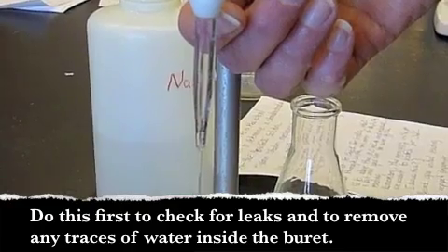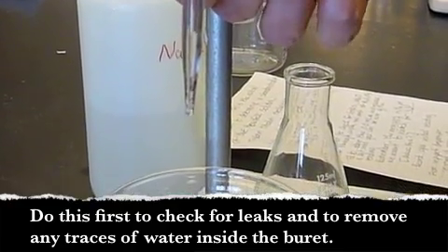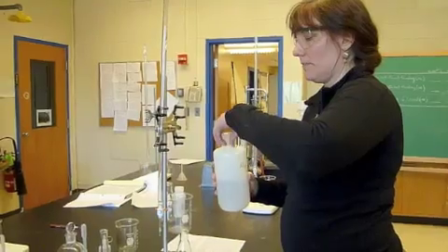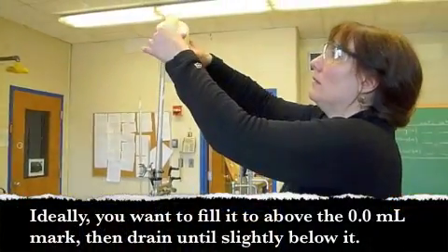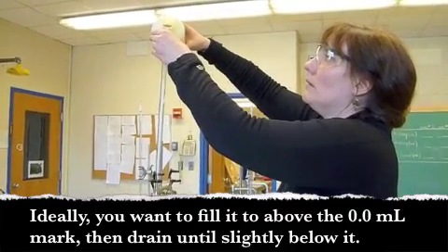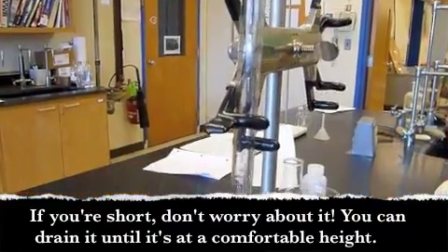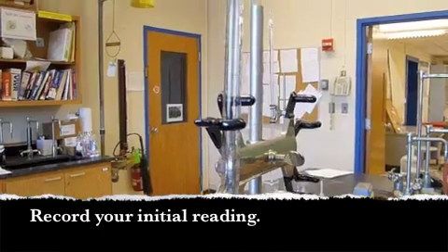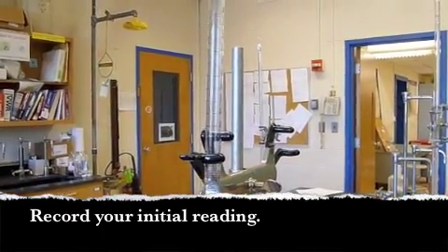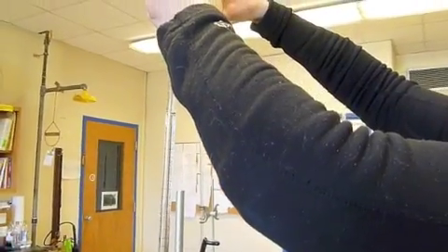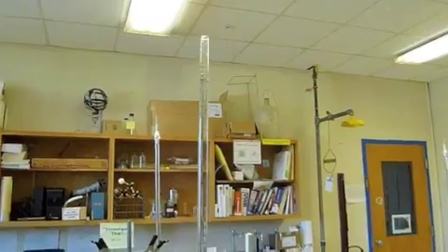We're going to fill this with our thiosulfate, which will be our titrant. We're going to fill it right up to the 0.0 mark as best I can.